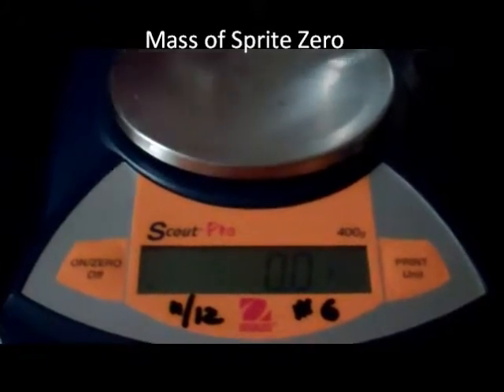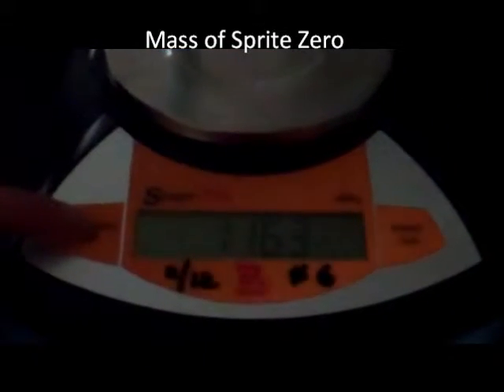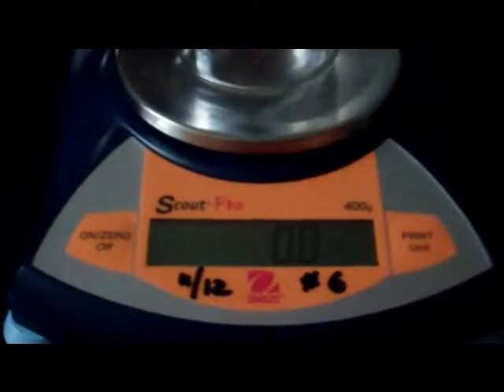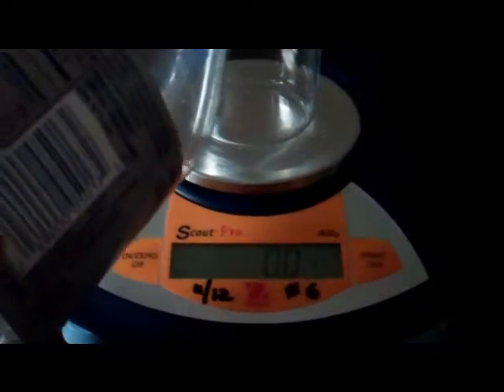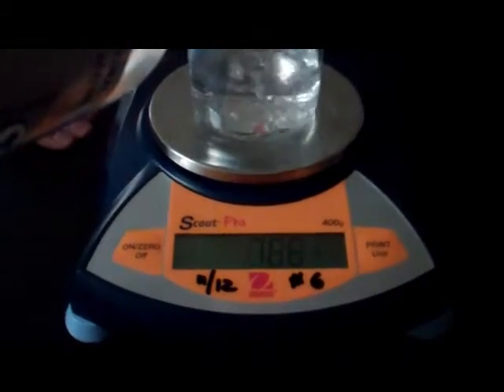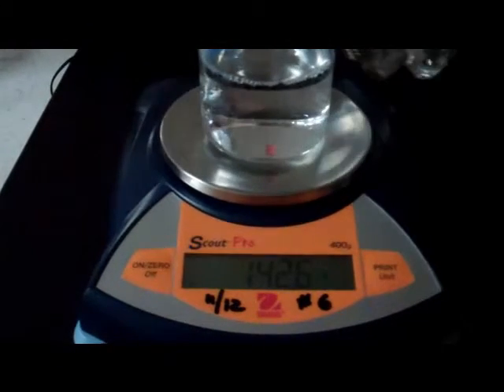First, I'm going to measure the mass of the beaker. Next, I'm going to zero out the balance so the mass of the beaker is not included in the mass of the Sprite. Now I'm going to add the Sprite, 150 milliliters. And the mass of that is 142.6 grams.